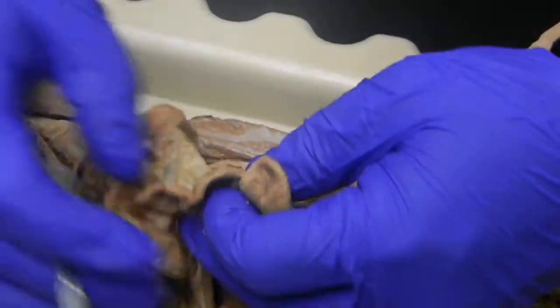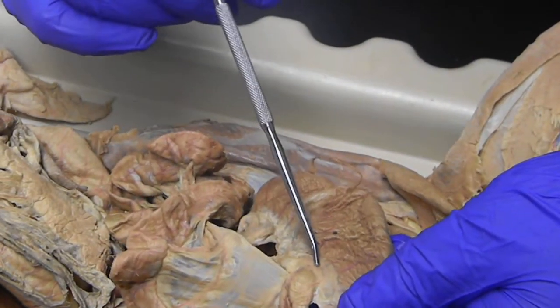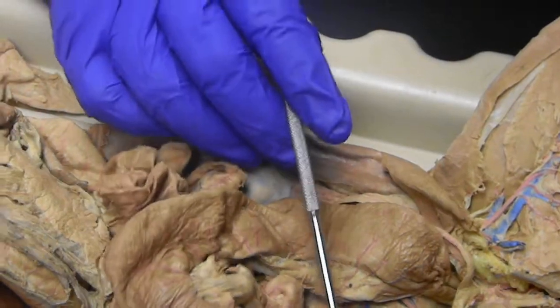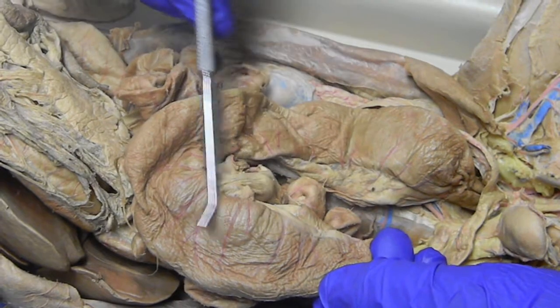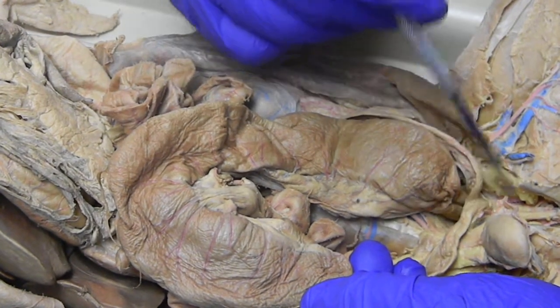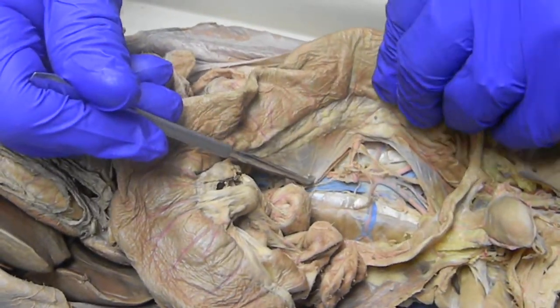As we get down to the colon, this is the last piece of the small intestine here — that's the ileum. In between here, where this thickening is, is the ileocecal valve. And we have the large intestine, the cecum. Again, in the human, the appendix would be right here. We have the ascending, transverse, and descending colon. And again, that should be sigmoid, then rectum, and then anus. Holding the colon to the body wall is this mesentery — that's the mesocolon.